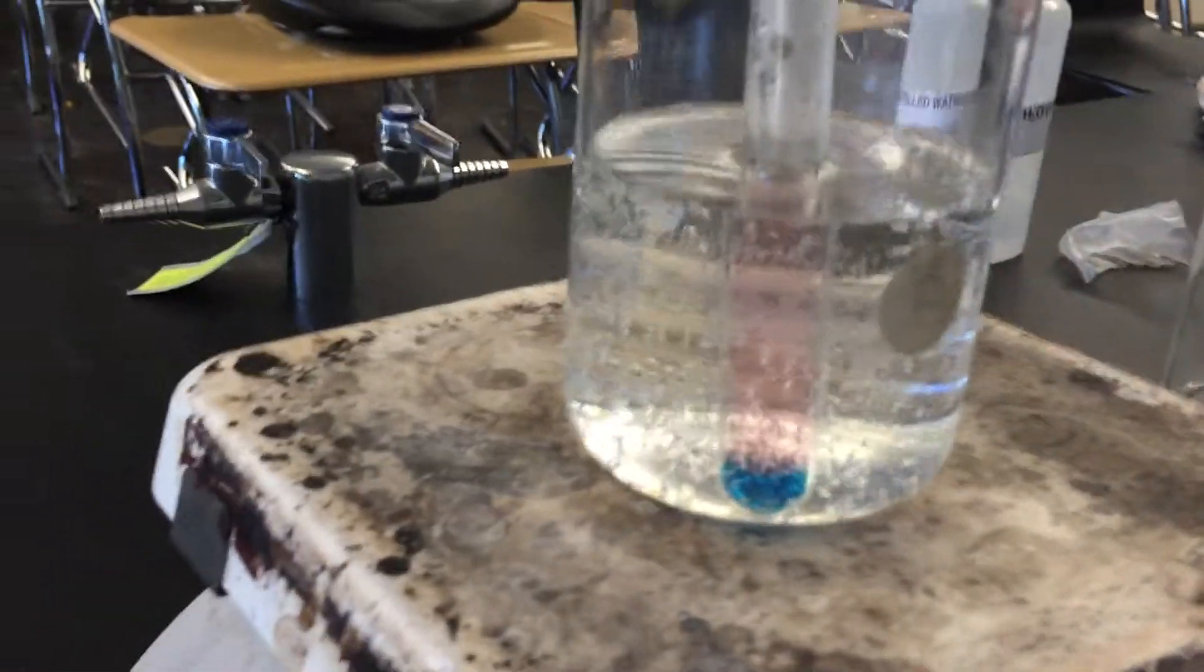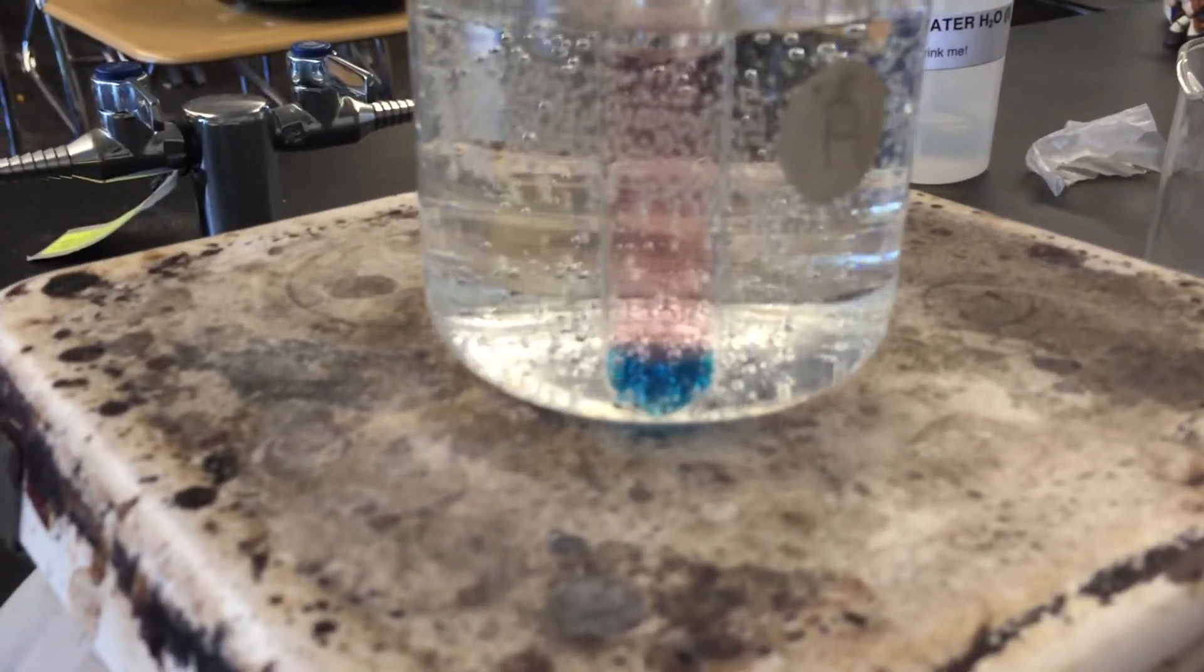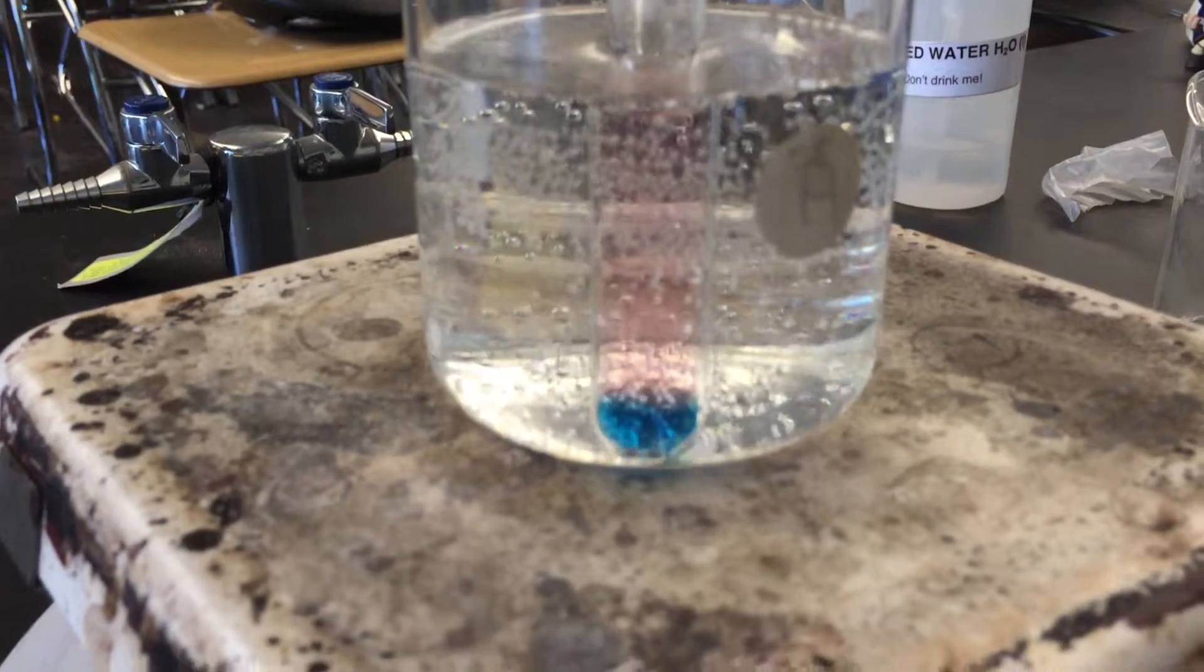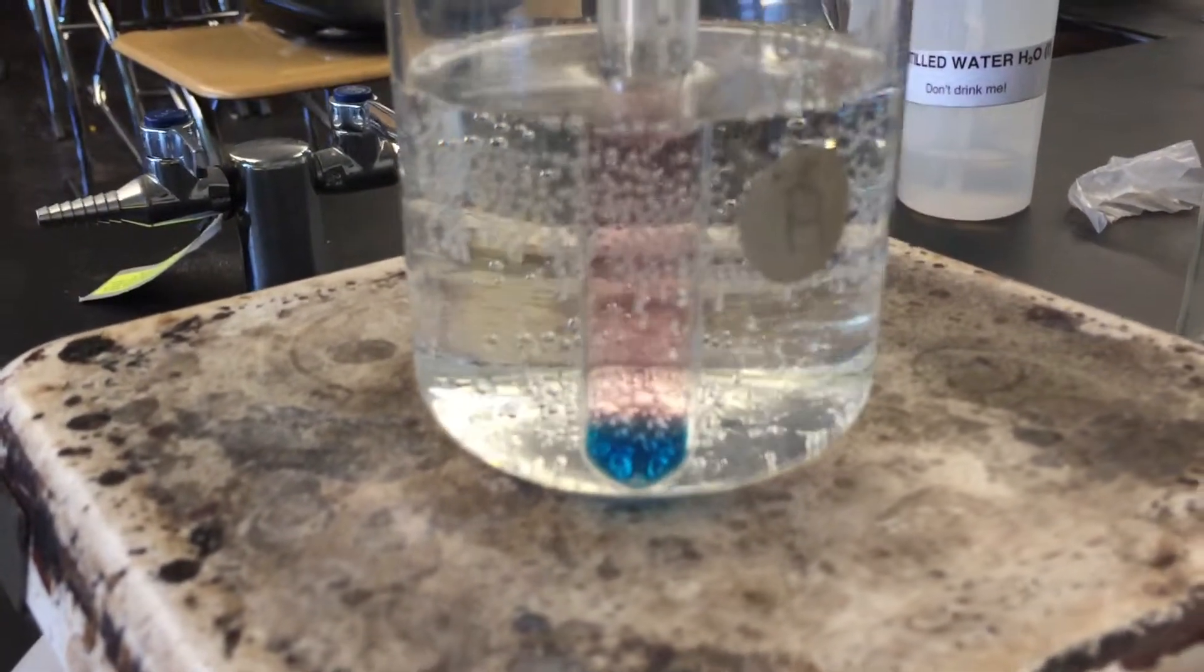Right now, as that solution heats up, gradually the heat is going to spread throughout the test tube, and I'm going to end up with a beautiful blue or purple color as that equilibrium reestablishes itself.